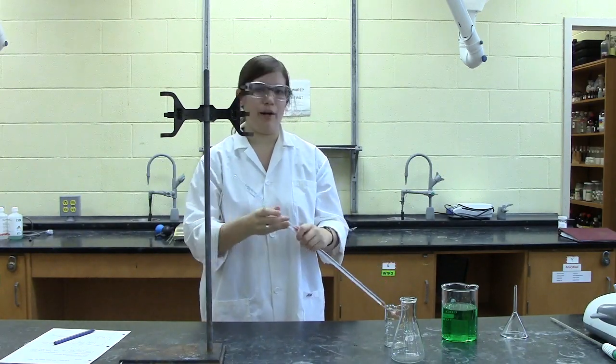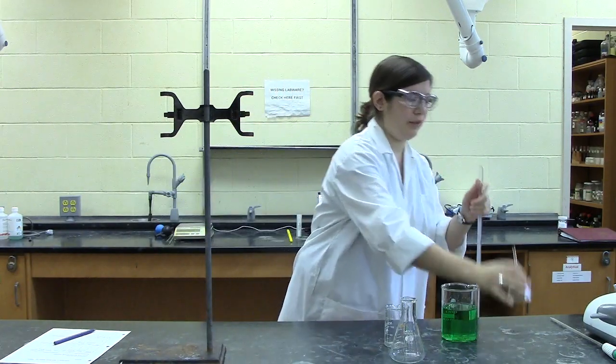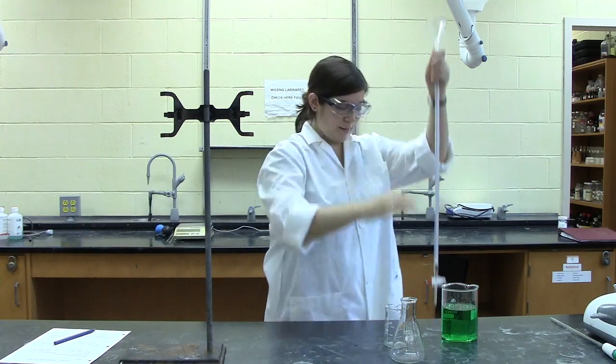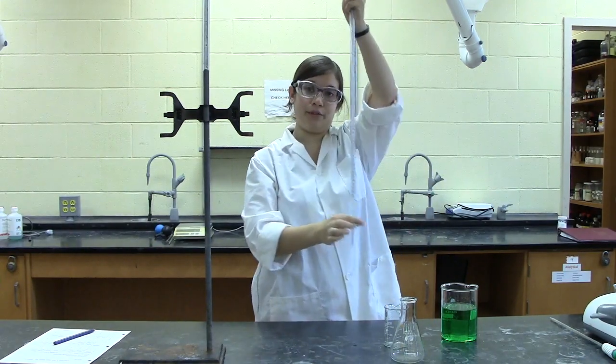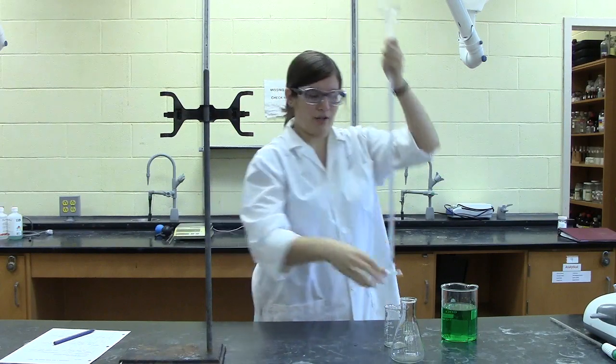Before using a burette, you may need to make sure that it's been rinsed with whatever solution you are using. So first, pour a little of your solution into your burette, making sure that the burette is closed with this valve parallel to the bench top.